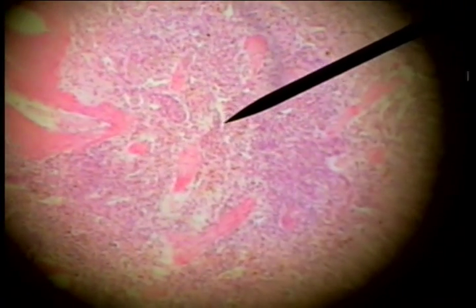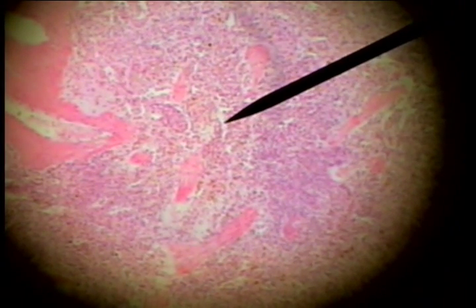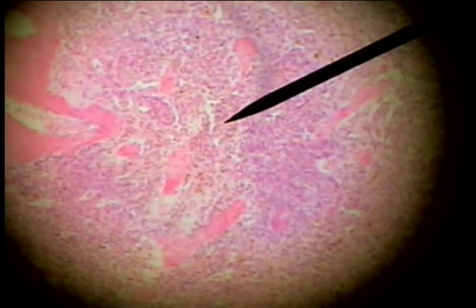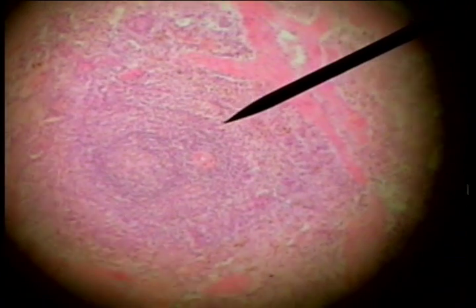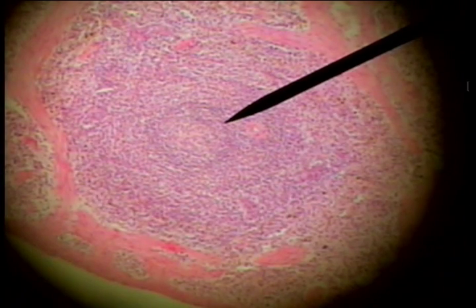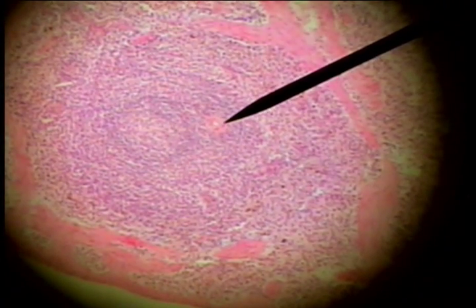There is a red pulp, which is light in color. These spaces are the sinusoids for movement of fluids through the spleen. These are the pulp cords made of lymphatic tissue. And then there's white pulp, which appears darker here, and is like a lymphatic nodule with its germinal center and corona.